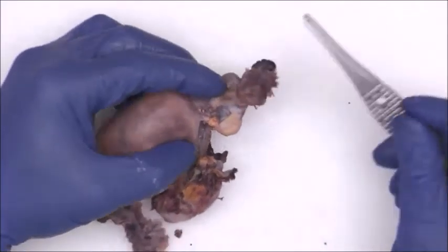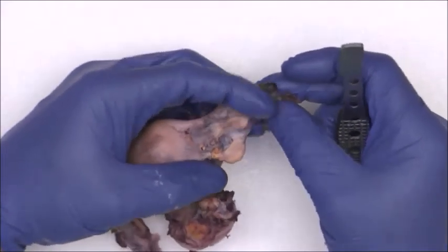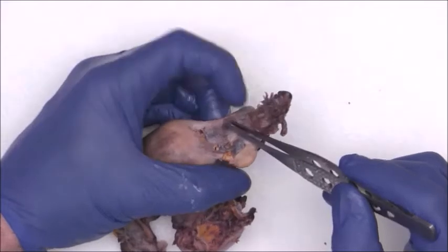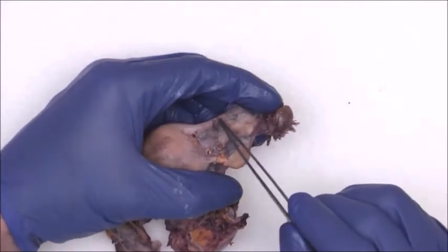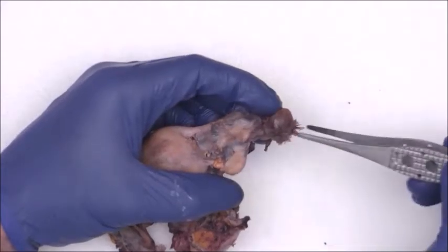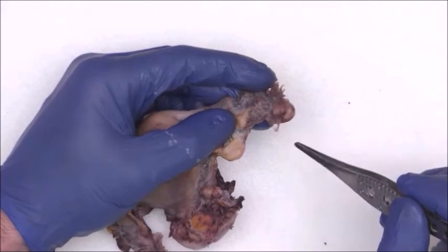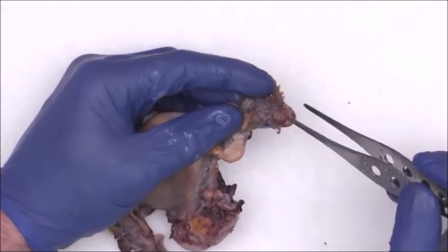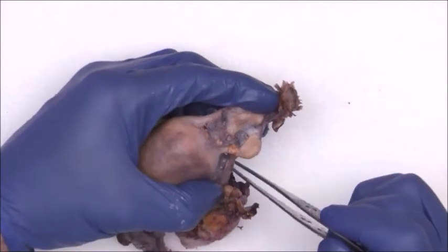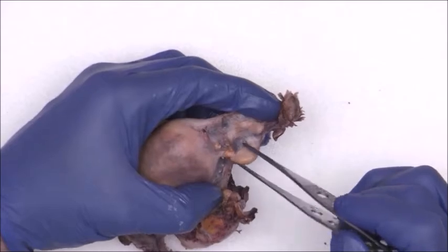Looks like, on this side anyways, there's a crimped area here, maybe even a past longitudinal defect from a possible past tubal ligation here. We've got some scattered adhesions. There's some adhesions here and here. Like I said, we've got the peritubal cysts. We've also got some tumor excrescences here, here, and here, which look like they're right on top of the ovary.